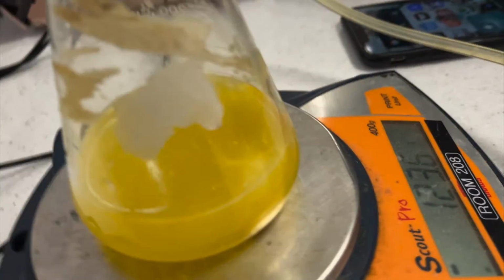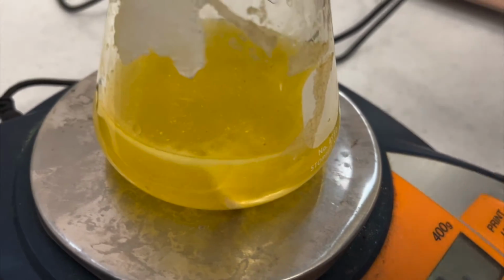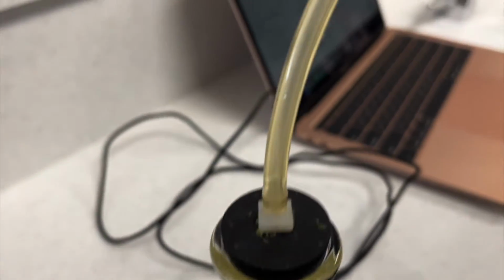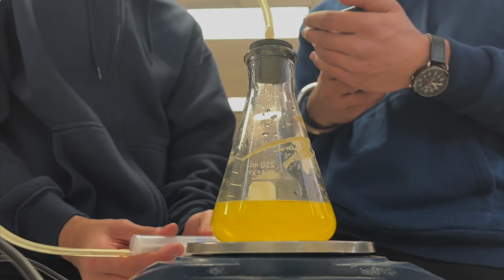Given that on contact with water, the effervescent tablet produces a gas, we know that there is a reaction that has occurred within the contents of the tablet, keeping in mind that the tablet is not pure ascorbic acid, as it has filler material and other binding agents.